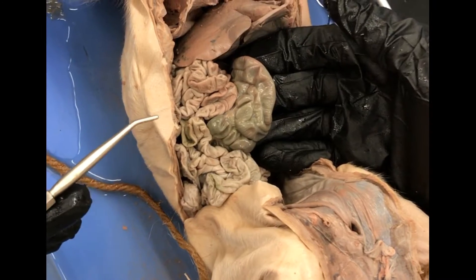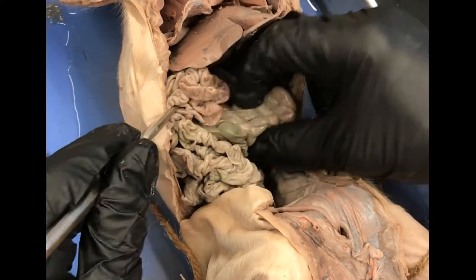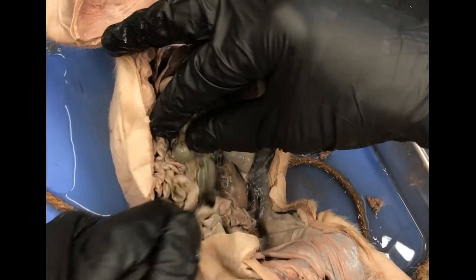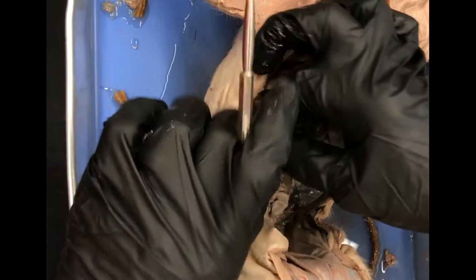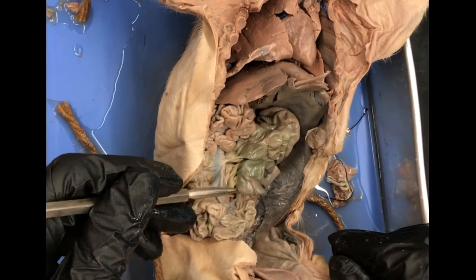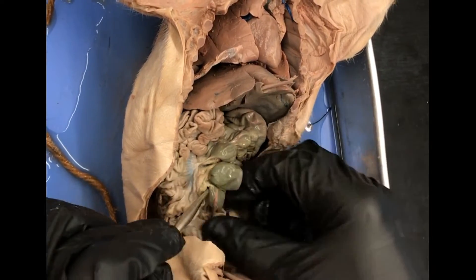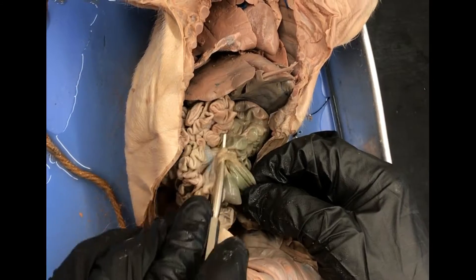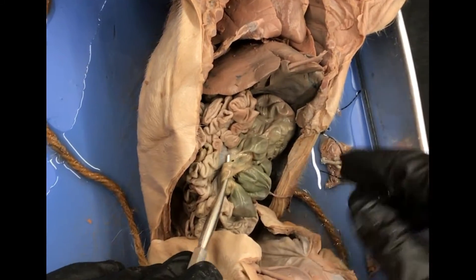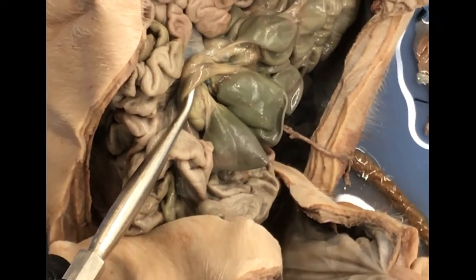It's not going to look the same as what we have in the cadavers or in the illustrations of humans. The beginning of the large intestine is the cecum. So the cecum is the beginning of the large intestine, and you can see where the small intestine ends — that's the ileum. If you're wondering how to identify ileum, jejunum, or duodenum: if I'm pointing to a section of the small intestine and you can clearly see that it's about to enter the large intestine, that's the ileum.